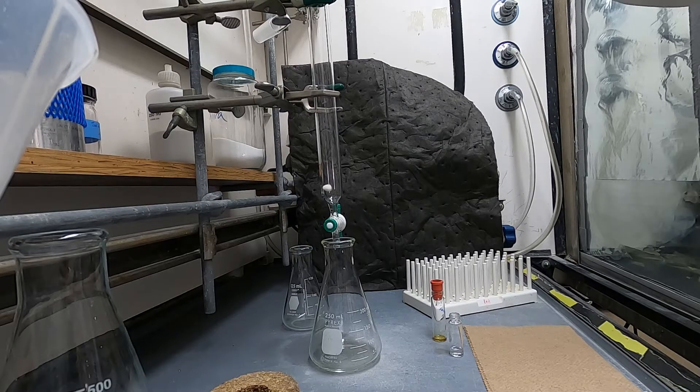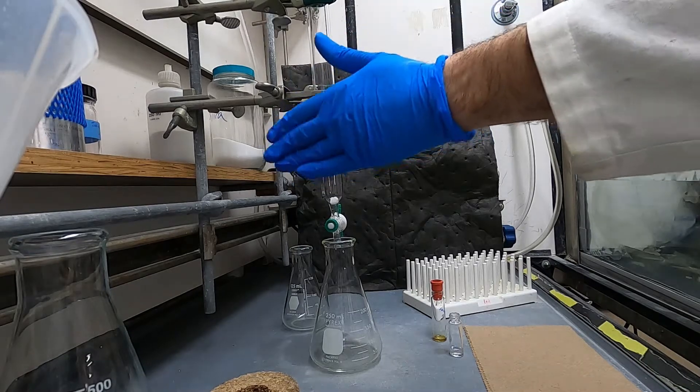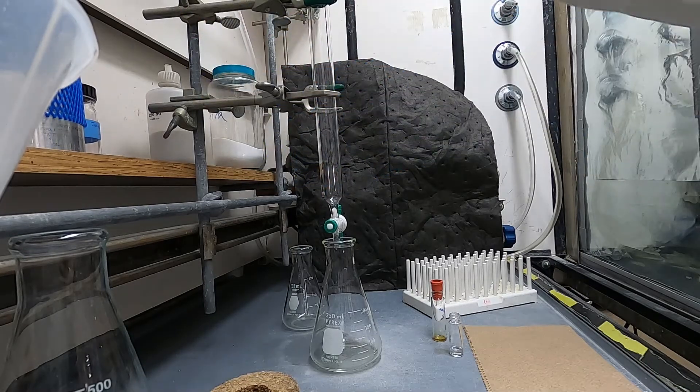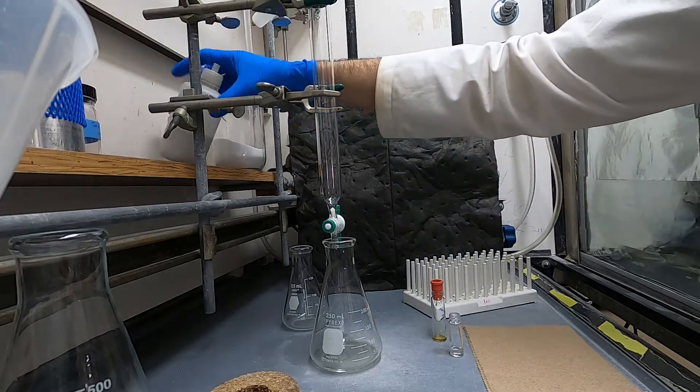Usually it doesn't go all the way in, so I use some positive pressure, in this case nitrogen, to get it to stick down in the little narrow spot.